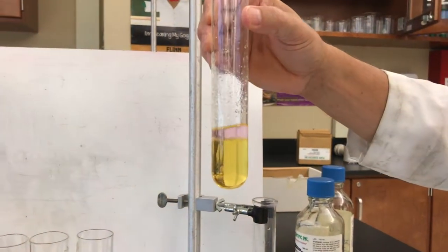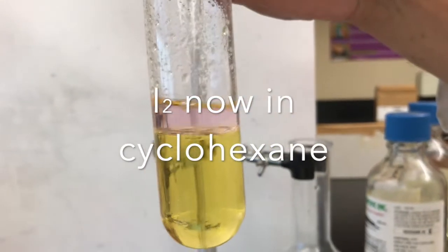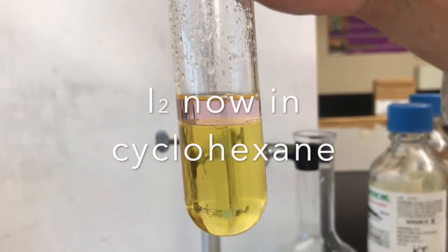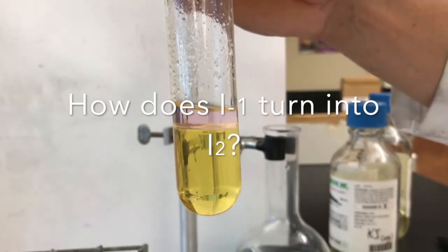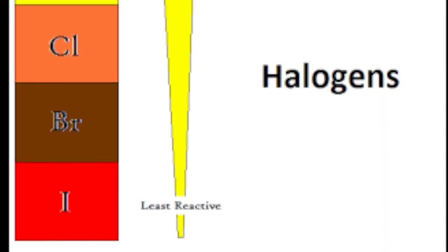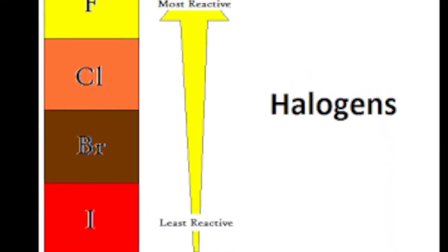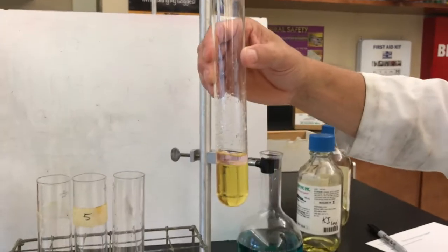This is the result of the aqueous bromine reacting with potassium iodide. And you can see that the cyclohexane's purple. So that implies that iodine's dissolved in the cyclohexane. So iodine got the boot in this case. It tells you that bromine is more reactive than iodine. It confirms that since bromine is above iodine, it's more reactive. If we did it the other way around, it wouldn't work.